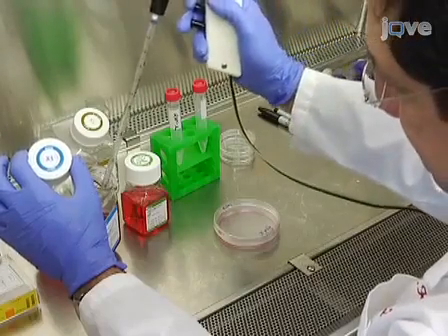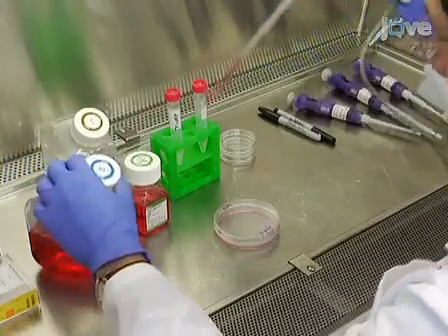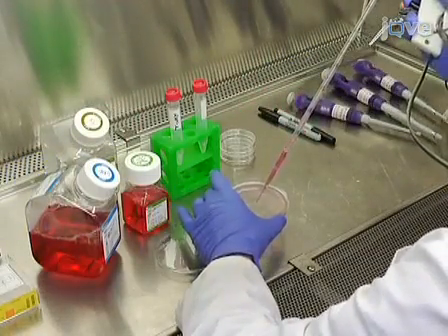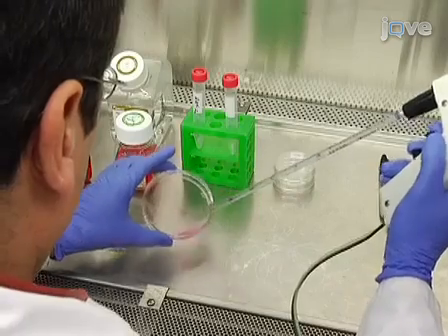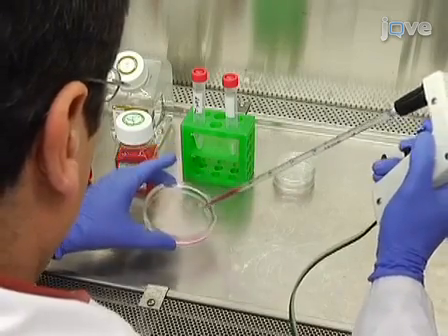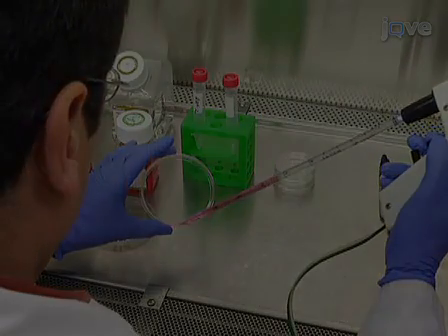Next, remove the plate from the incubator and halt trypsinization by adding 2ml of complete medium. Use a 5ml pipette to triturate the mixture until the cells are fully in suspension.